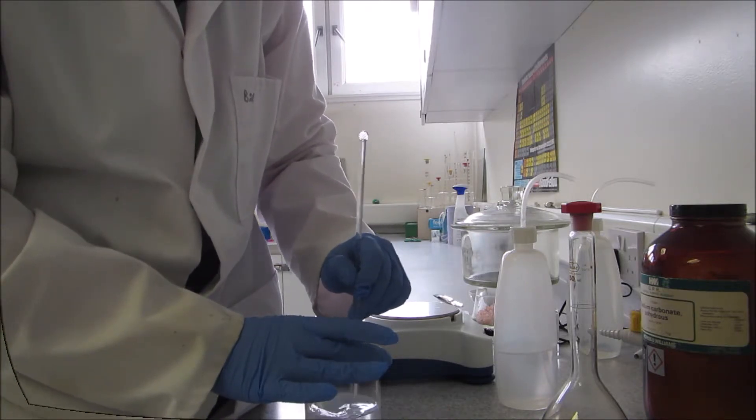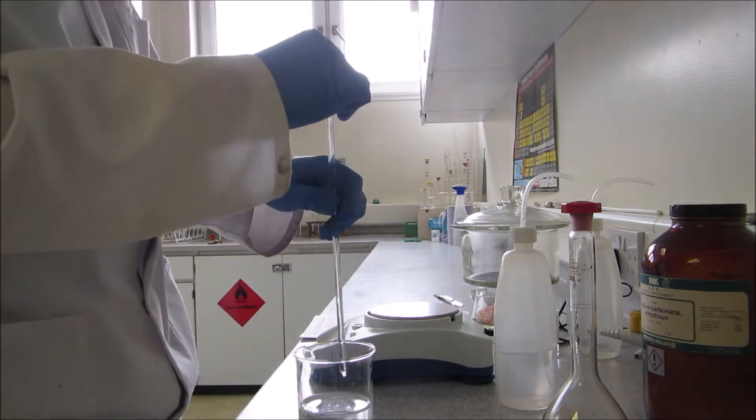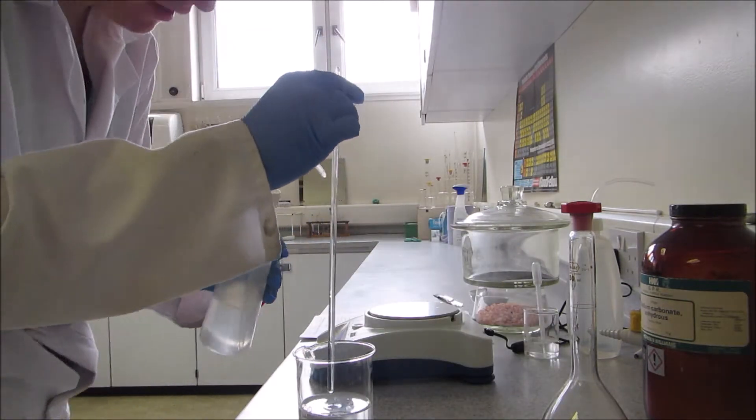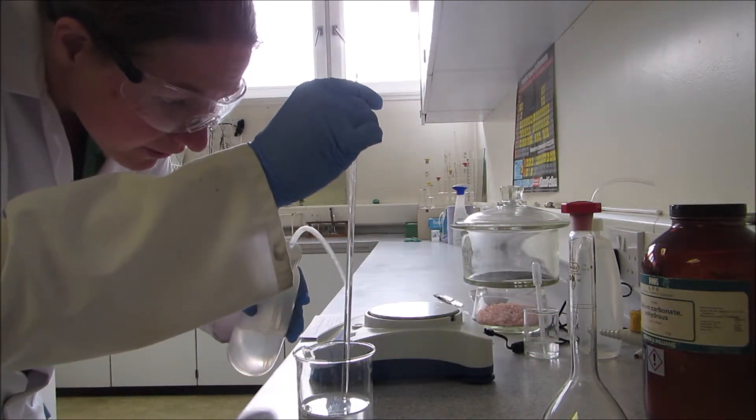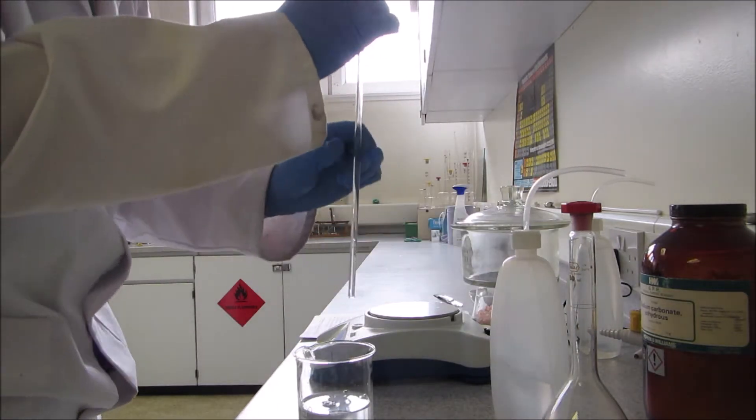This can take a little while. I can't see any remaining salt so I'm happy that it's all dissolved now. But before I put my glass rod down, this could have some of my sodium carbonate solution, so I'm just going to give it a quick rinse with the deionized water into my beaker. So I'm happy that's got off my sodium carbonate.